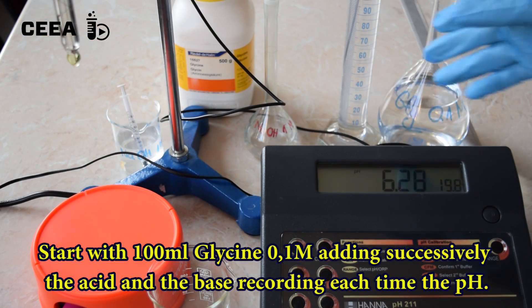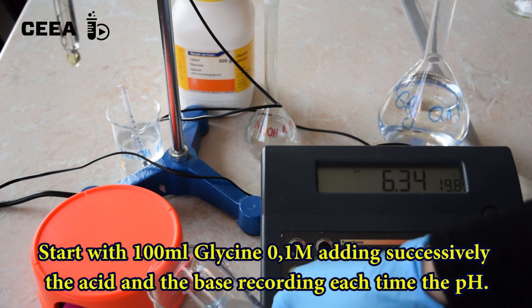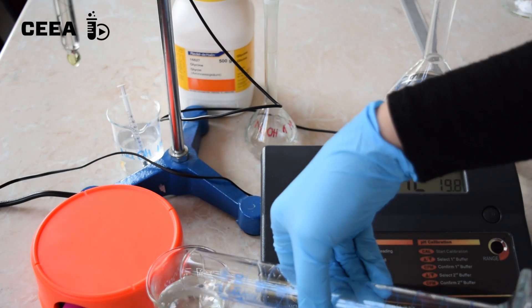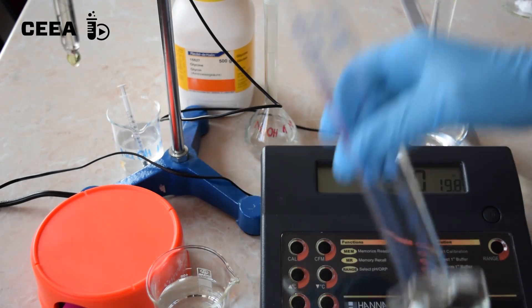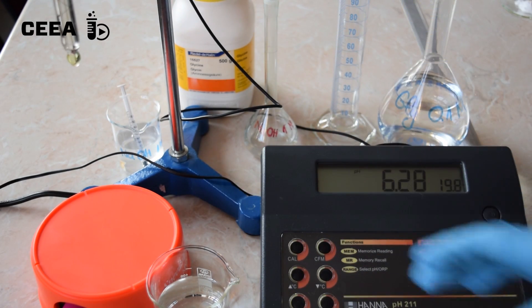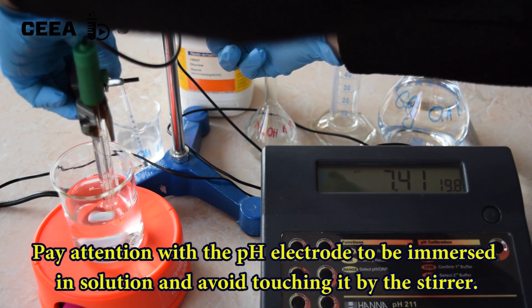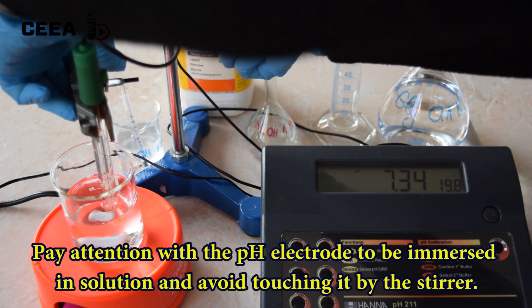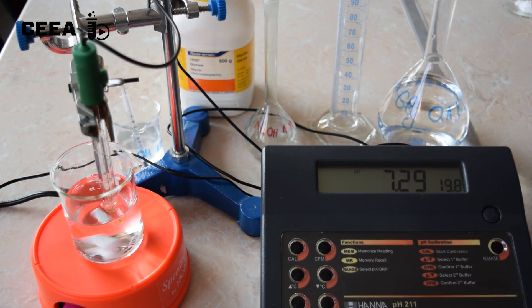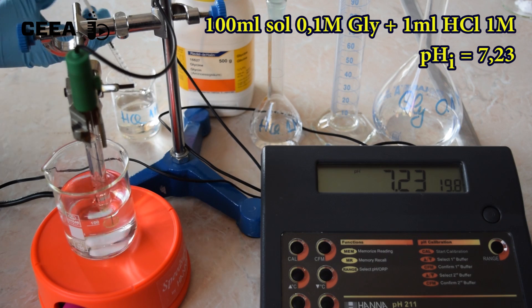Start with glycine. Record the pH variation when adding successively 1 milliliter of strong acid. Place the beaker with 100 milliliters of amino acid solution, read the pH, and add the acid or base to see the variation of the pH.